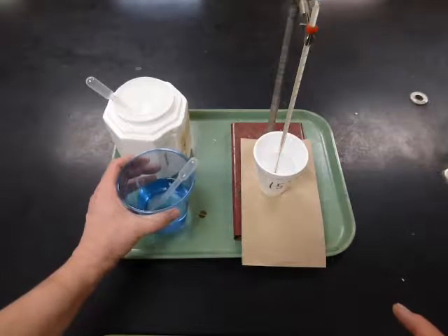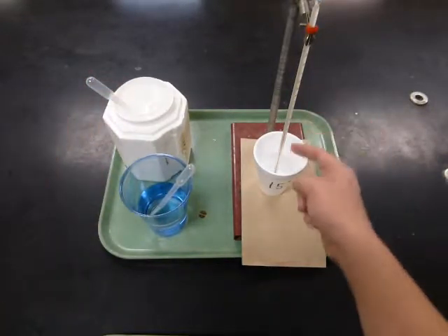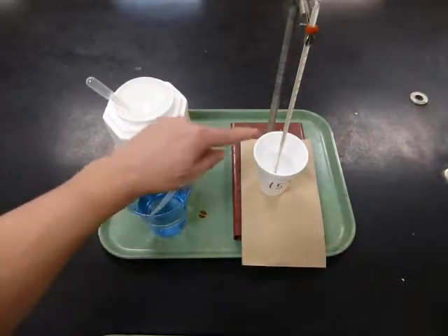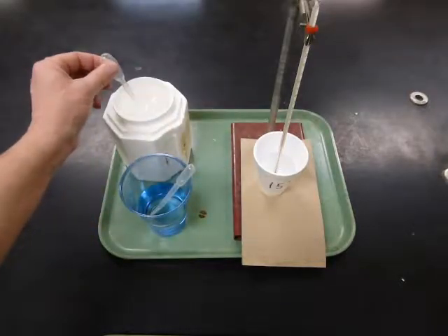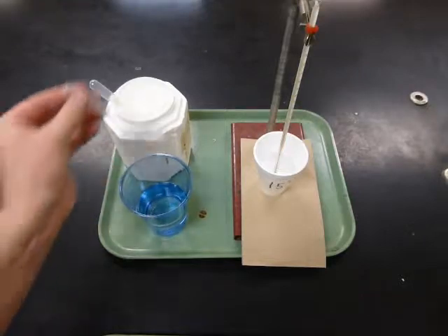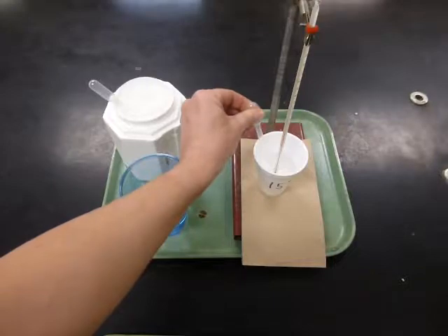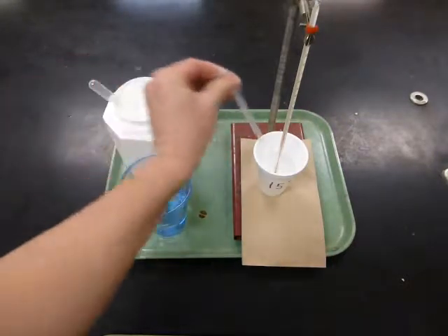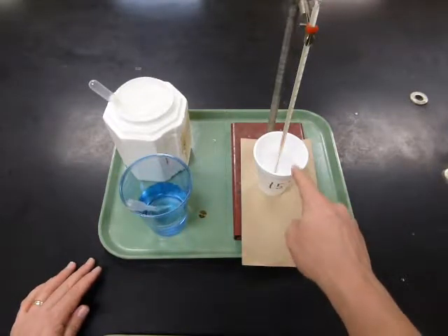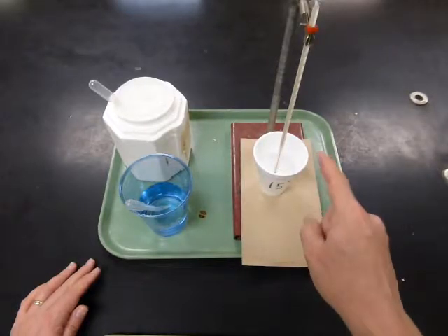You can start by adding some room temperature water, and then you can add an ice cube from here. When the temperature gets down to 15 degrees, you can take out the ice cube, but put somebody in charge of keeping an eye on that temperature, in case you need to add more cold water to bring the temperature down, or more room temperature water to bring the temperature up. Please make sure to do that. If you need to take some water out because it's getting too full, you can use the squeezy pipettes for that too. So one person should be in charge of keeping track of that temperature. It should stay 15 degrees at all times so that it doesn't change.